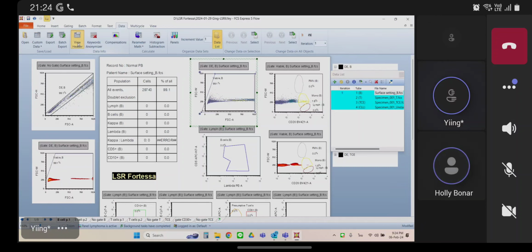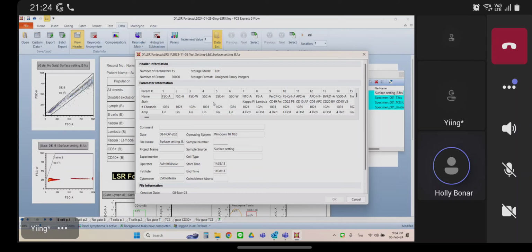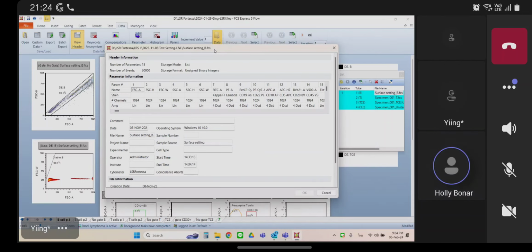It's the same issue though, because this data set has 6 scatter parameters and it should only have 5 for this layout to work. That's the issue. So your data going forward needs to consistently have the same number of parameters. It doesn't matter how many they are. It can be the 6, like you could export the widths here, just like you did, or you can take them out if you're not using them. But whatever you decide to do, you have to do it consistently going forward.